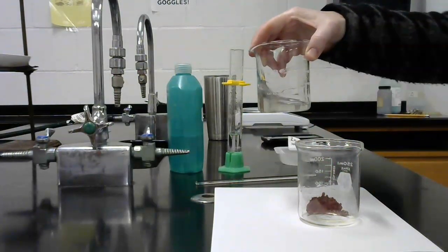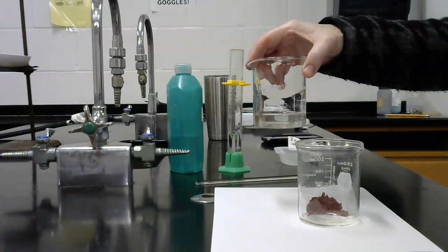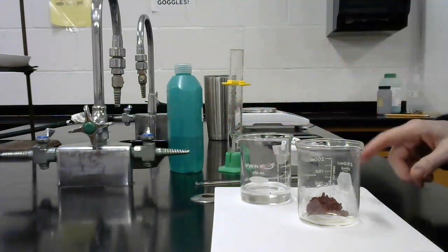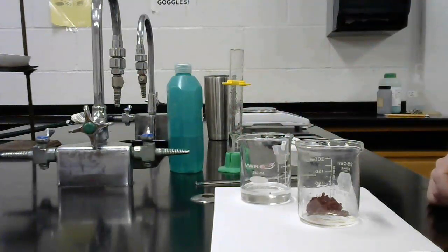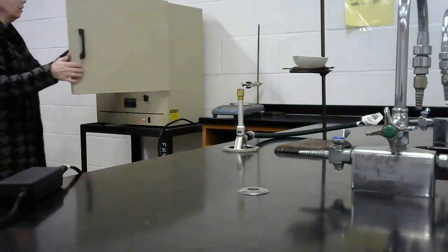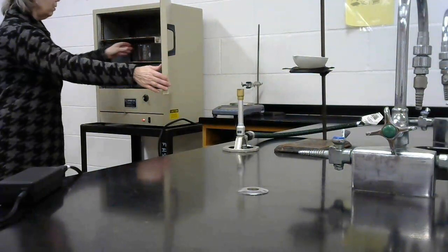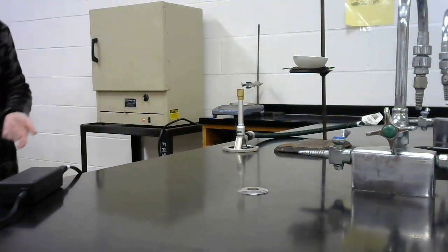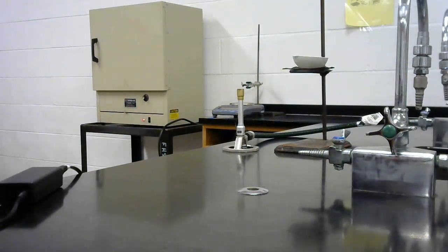Here's, we call this the supernatant. This is the liquid that came from that solution after the zinc reacted. It made all the copper drop out, so now it's just a clear liquid. So we will dry that copper to get all the moisture out of there, and then we will mass the beaker again to get the mass of the copper that was in there. Here's the drying oven. We will put this in here to dry. It will take about a half an hour. Once it's dried, we'll take it out of the oven and then mass the copper that was produced.